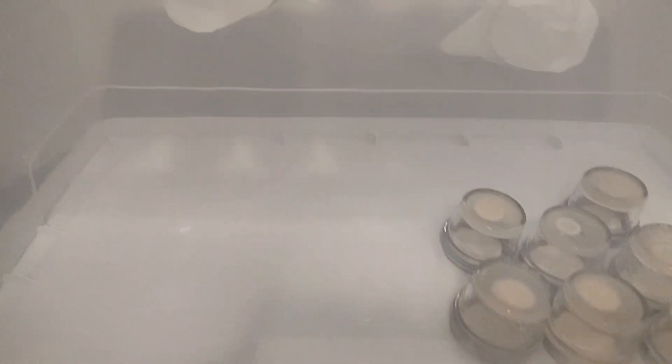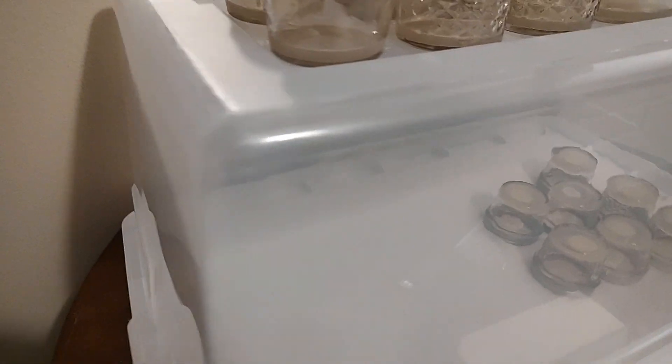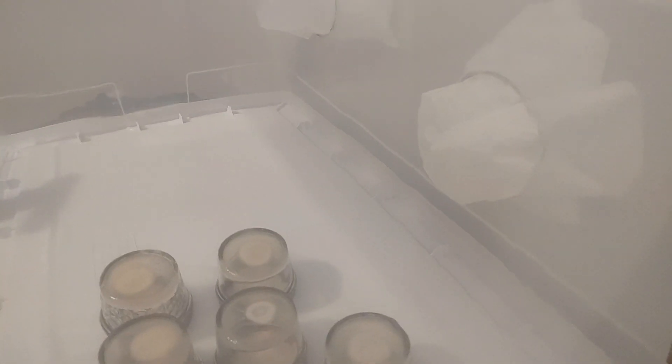Before I actually do any work I just wanted to show you this process because so many of you asked. I do like this — see, there's not a lot of holes around the side here. Then I come over here and you can see all the alcohol in the SAB. I move the table against the wall so I don't have air really getting back there — at least my AC is not blowing into it. There's tons of alcohol and I like to say it's self-cleaning right now.